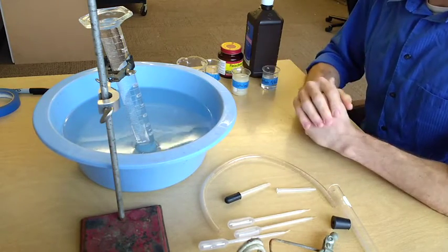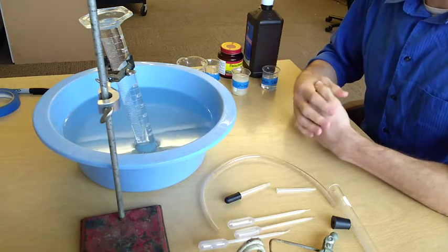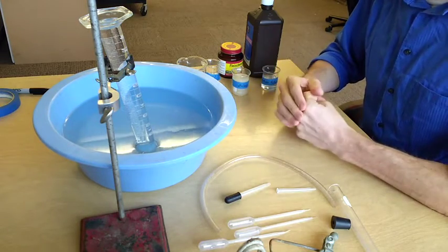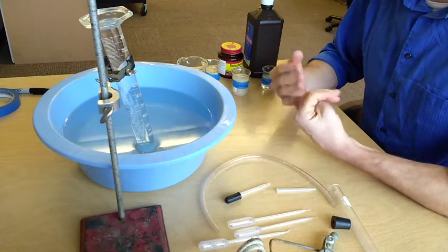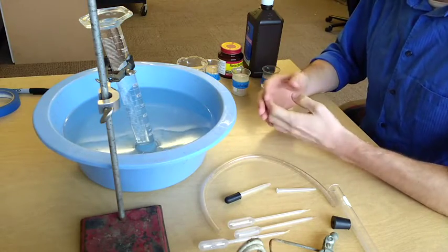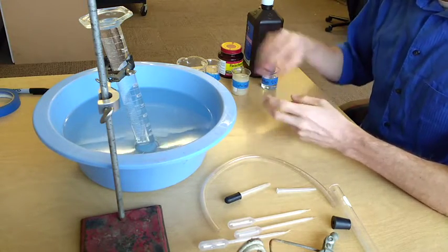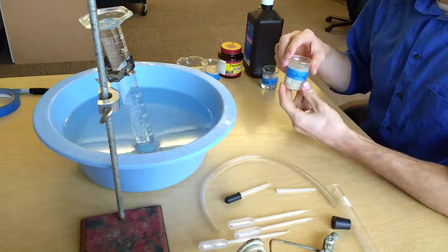The basic setup that I'm going to show you here will allow you to set up an experiment where you can test some variables such as temperature or pH to see which temperature or which pH catalase reacts fastest in.